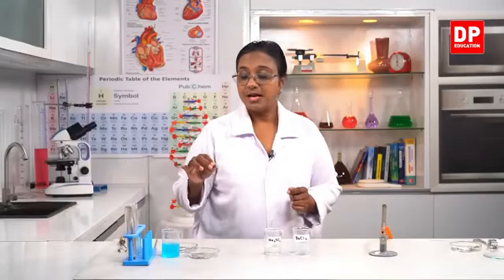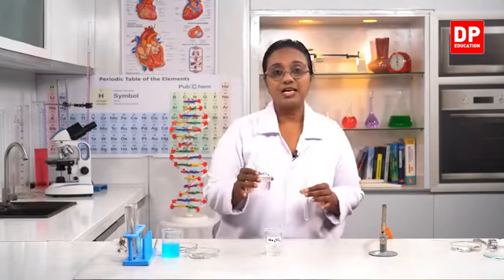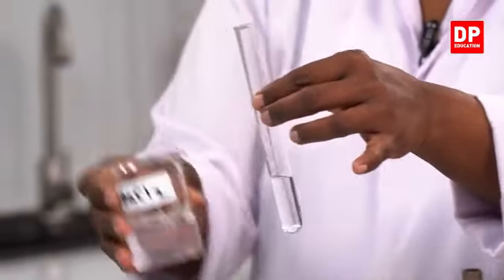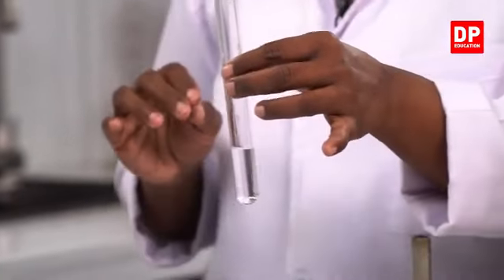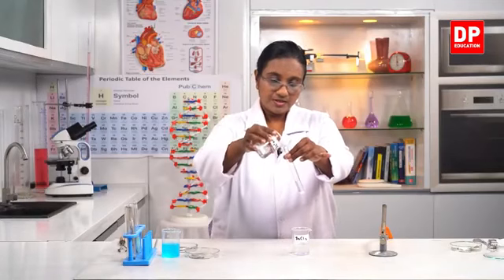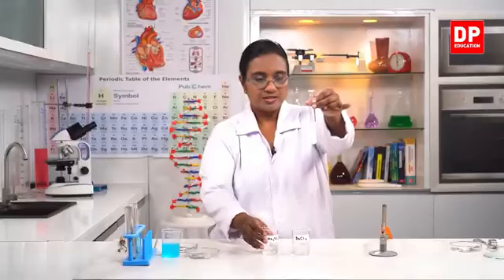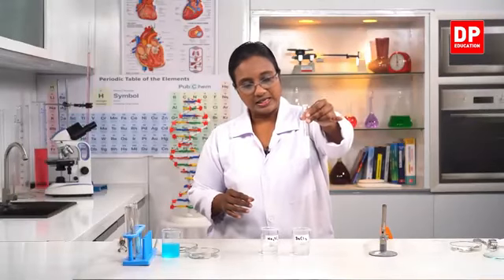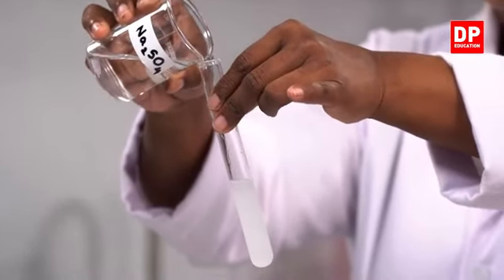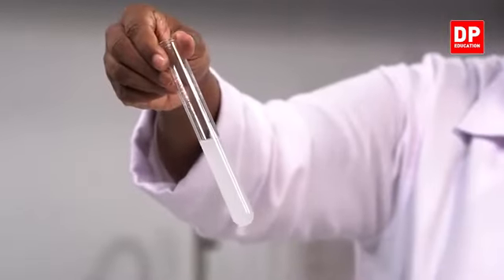For this step also, I'll be using a test tube. I will take a test tube. Into that, I will take a small amount of barium chloride. And into that, I will add sodium sulfate. When I do that, observe what happens. So here, when I add sodium sulfate, you all can see, students, the solution became milky in color. And when it reacts, I'll add a little bit more. You will see it has become milky in color.